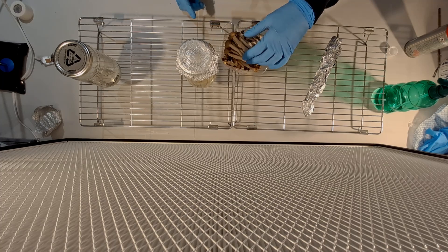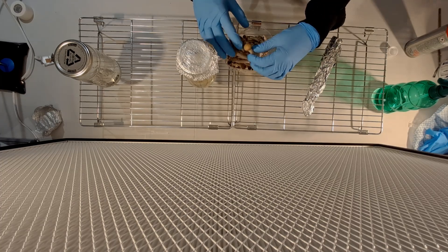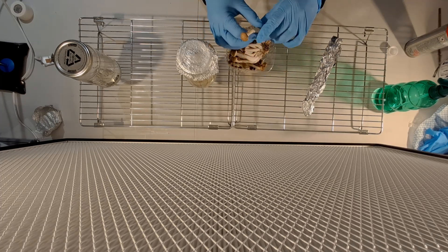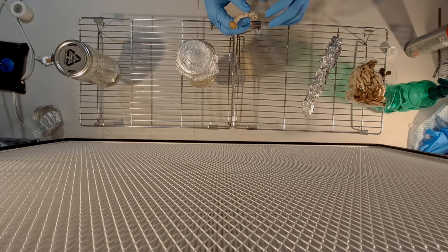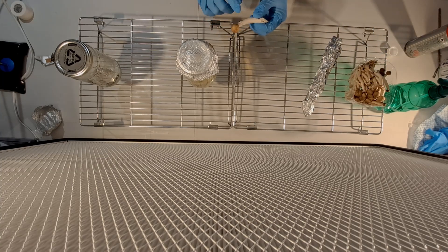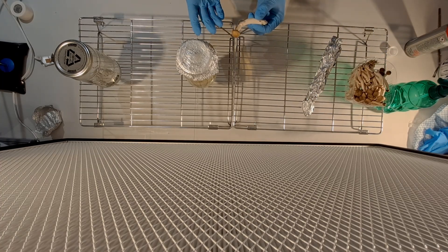I've got all the items in front of the flow hood here. That flow hood isn't actually turned on because I'm just going to show you the technique on how to get a good biopsy from the mushroom.